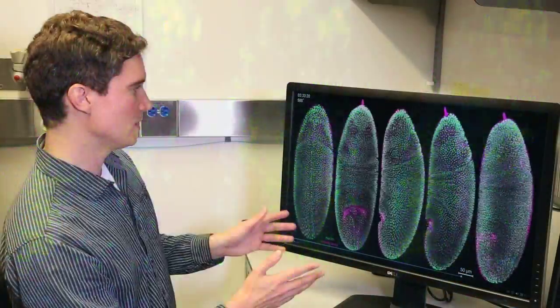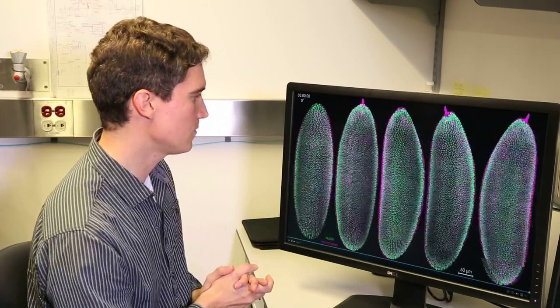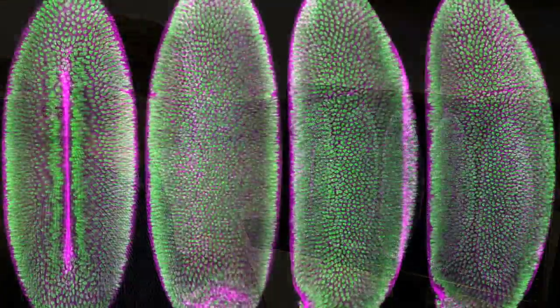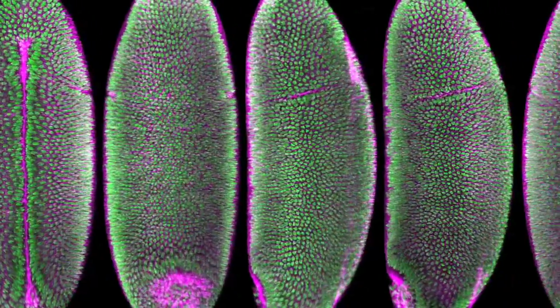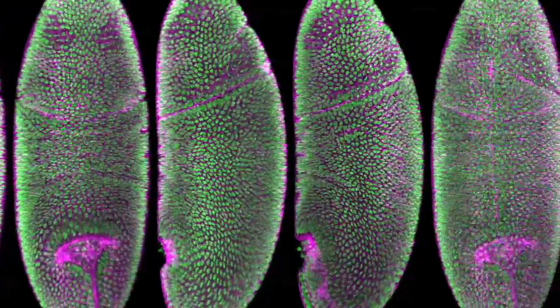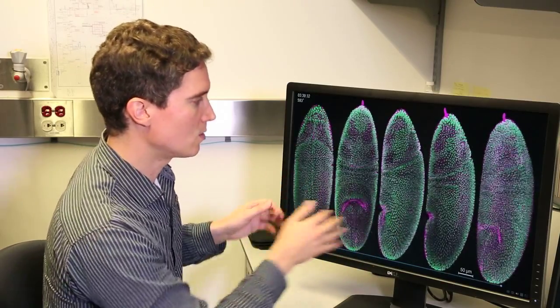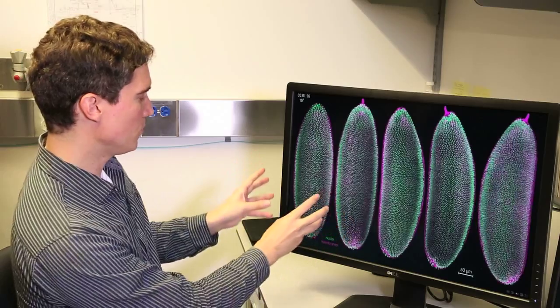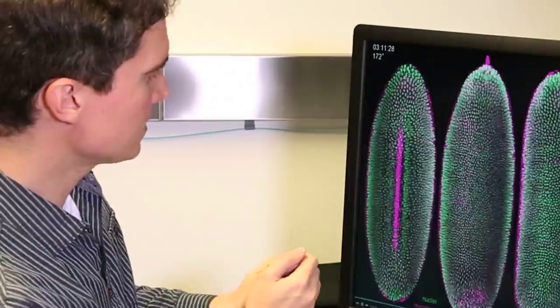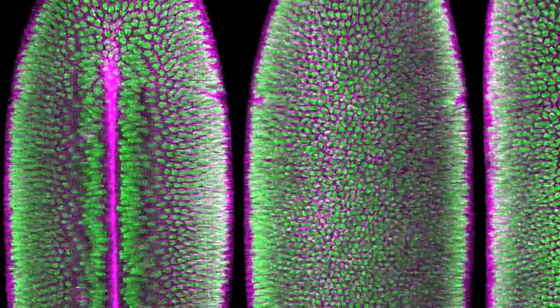In this video, we're looking at an entire developing Drosophila embryo. It's a fairly early stage Drosophila embryo. At the beginning of the video, just slightly younger than 3 hours after egg laying. And it undergoes a fairly dramatic sequence of tissue rearrangements and morphogenetic processes. We're going through gastrulation and basically image the entire embryo in 4 second intervals for multiple hours, while at the same time capturing both the movements of the cells. You can see these green blobs, which are the nuclei of the individual cells, but also in this pink marker, the membranes and cell shape changes of all of the cells throughout the embryo.